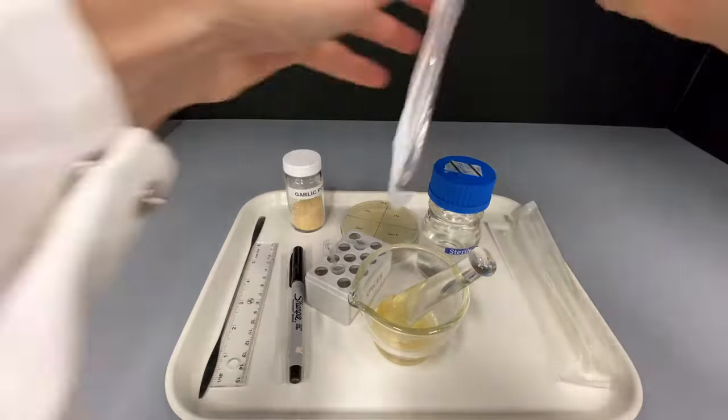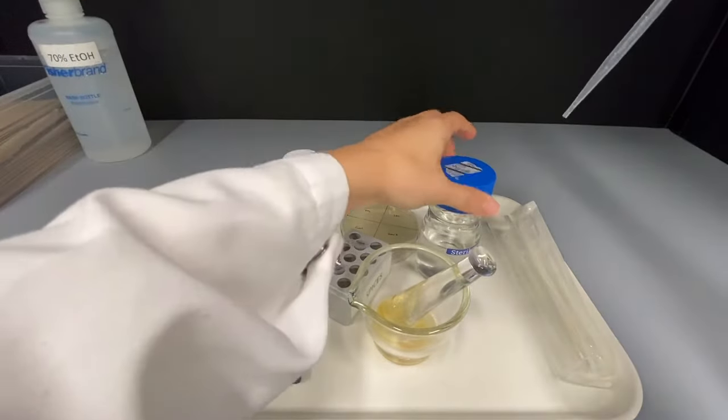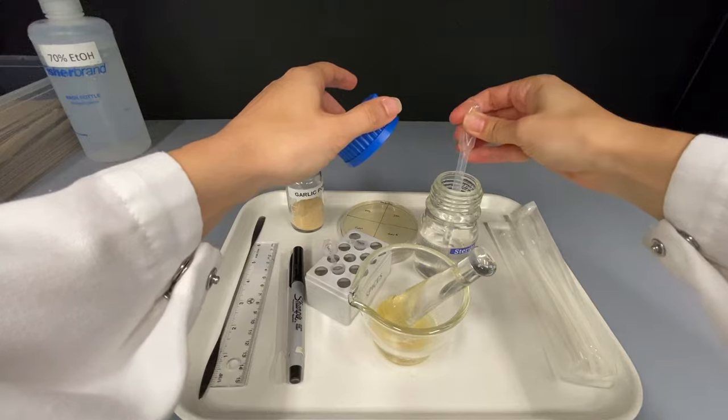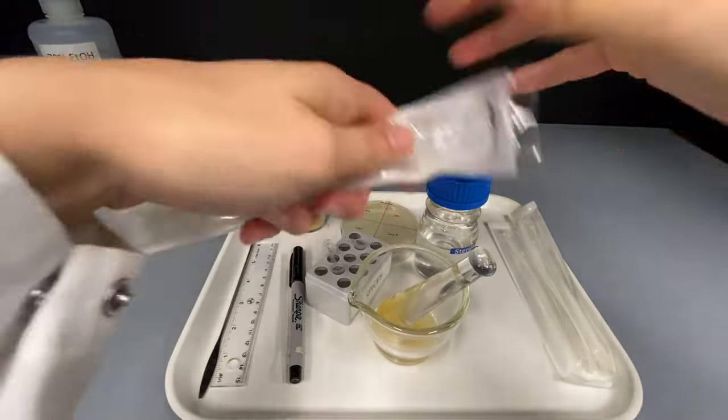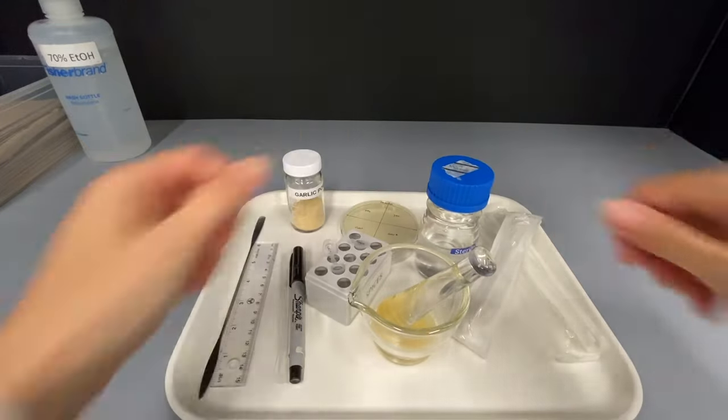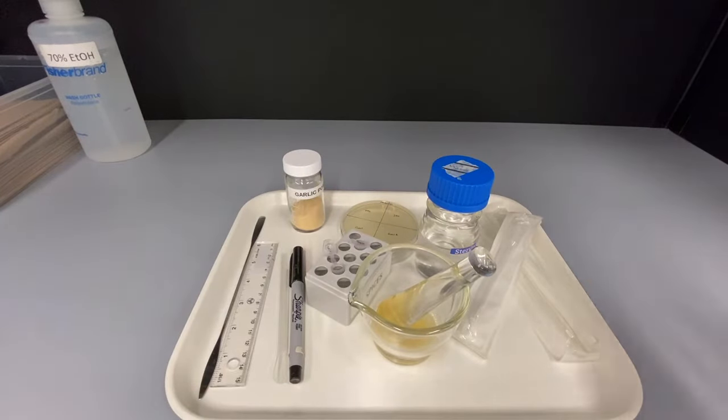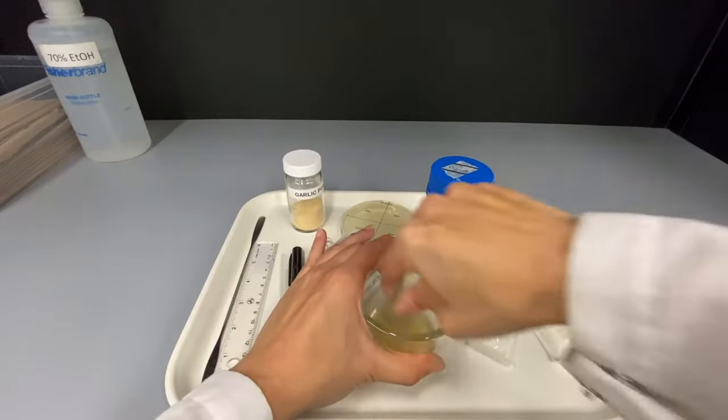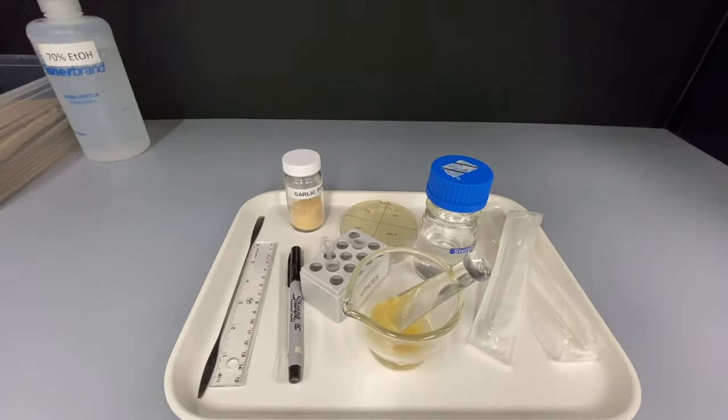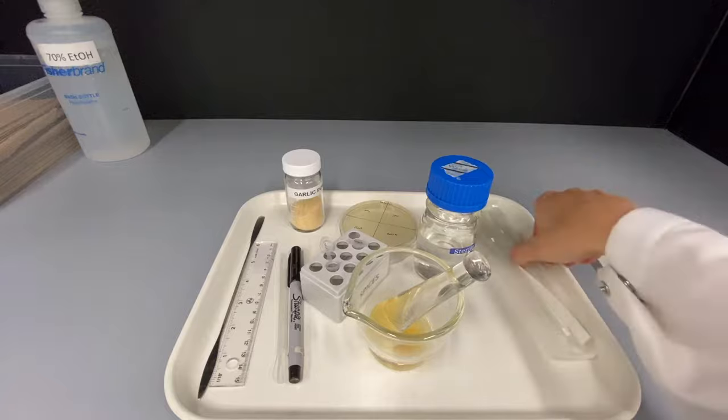Add an additional 2 milliliters of sterile water. Grind for another 10 to 20 seconds. This is your stock solution of garlic.